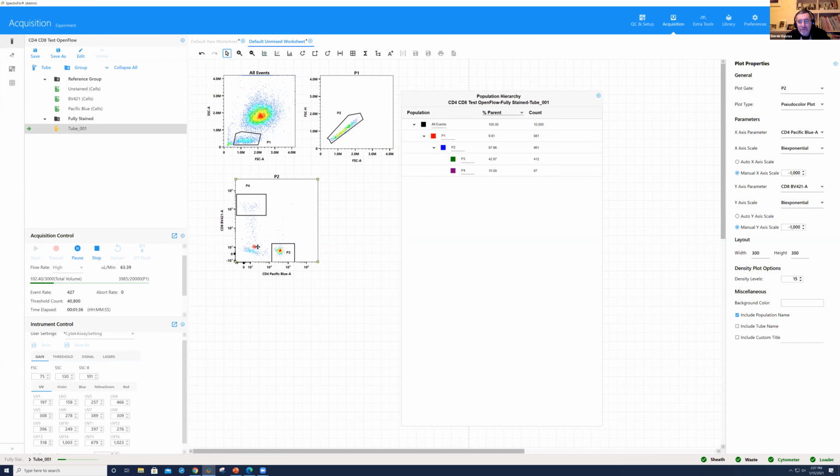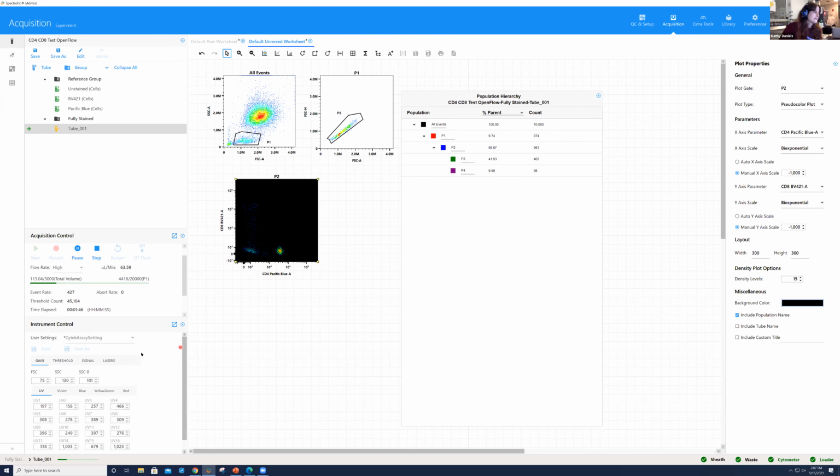Yeah, there's a couple of questions here, Kathy, and maybe I'll start with the easier one. Do you save width? You can get area, height, and width in the same way we can normally, and do you save that? Yes, so that is typically something I do at the beginning of an experiment. If you go to signal, you do have the capability to enable width at the very beginning of the experiment or before you start running.